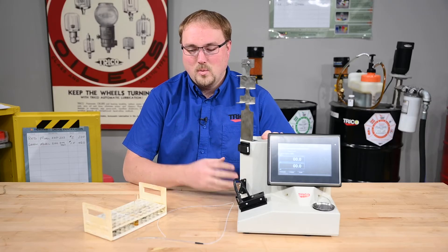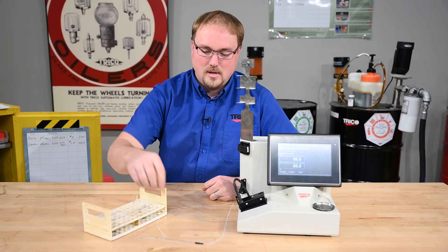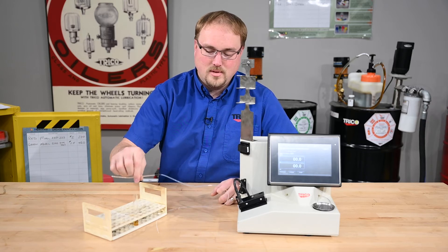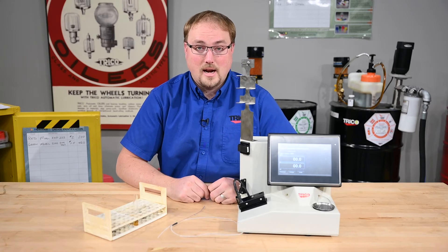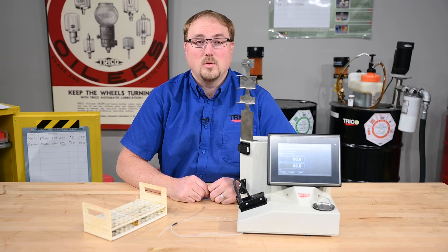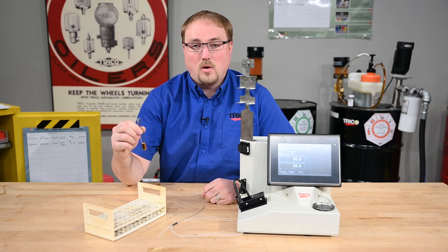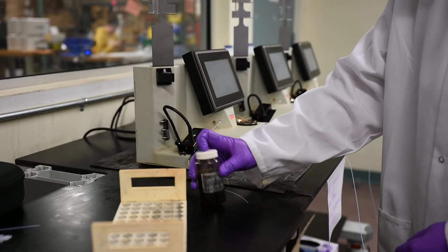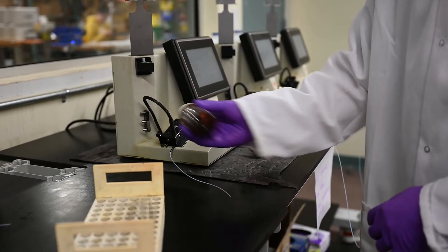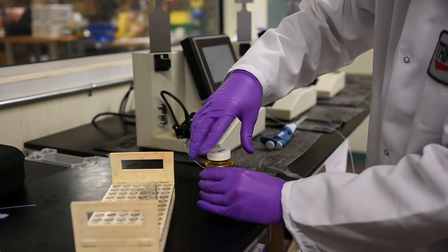To run the DR7 unit, we need a vial with oil as an oil sample and a precipitator tube. Both of these are not included with the DR7 purchase — they are separate add-on items that are disposable and only supposed to be used once per oil sample. To prepare this oil sample, we took an oil from our oil analysis lab, took one milliliter of the oil with two milliliters of heptane. Before we took the one milliliter sample of oil, we warmed it to the correct temperature and shook the oil vigorously to evenly disperse the particles throughout the oil.